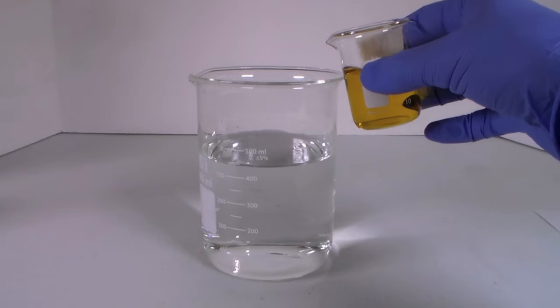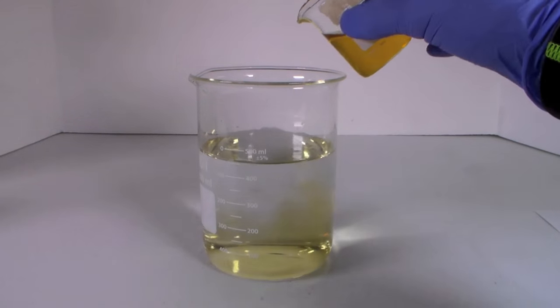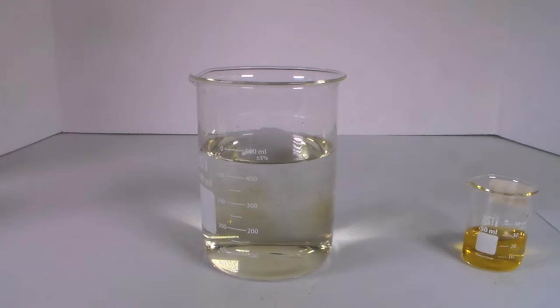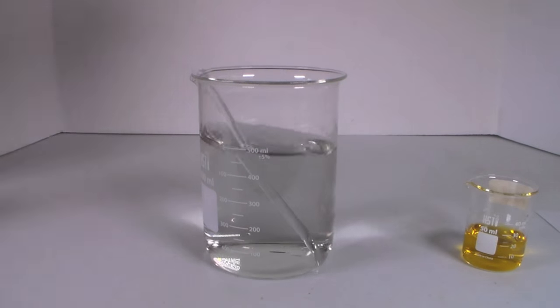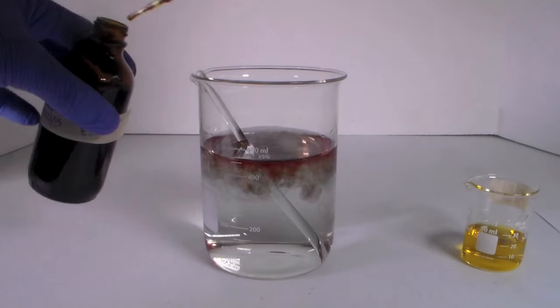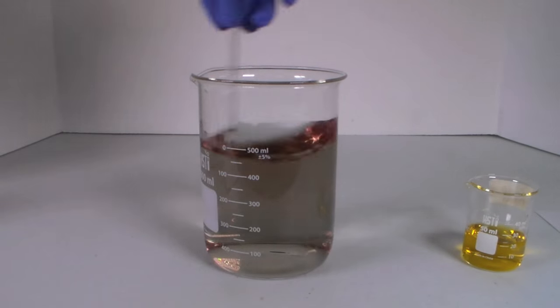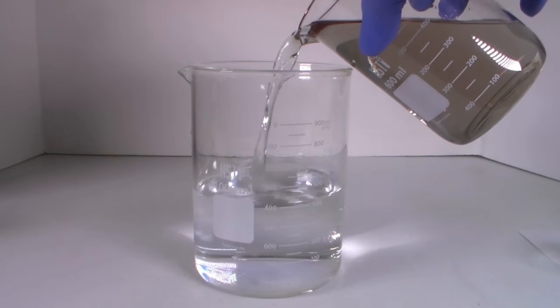I wanted to show you what bromophenol blue looks like in a dilute acid so I slowly added the vinegar solution to a large amount of tap water to dilute it. I then added a bit more indicator and mixed this in.